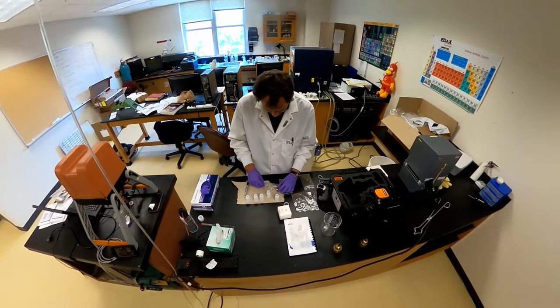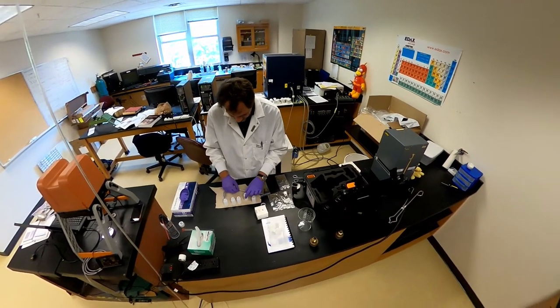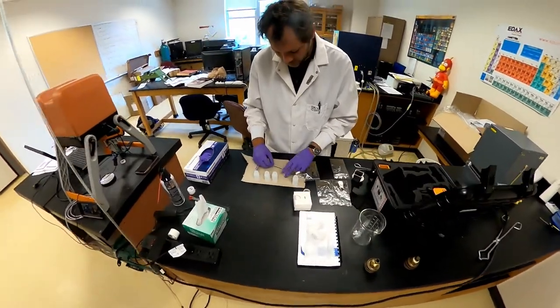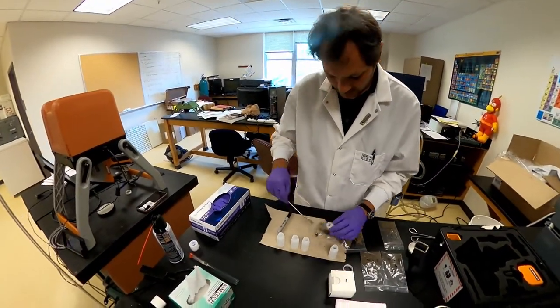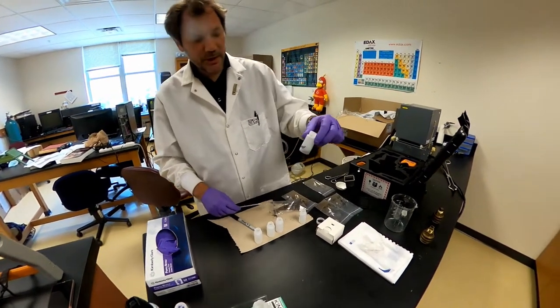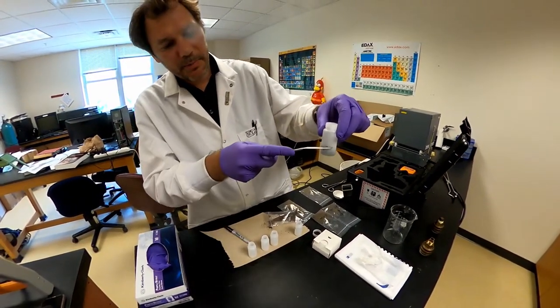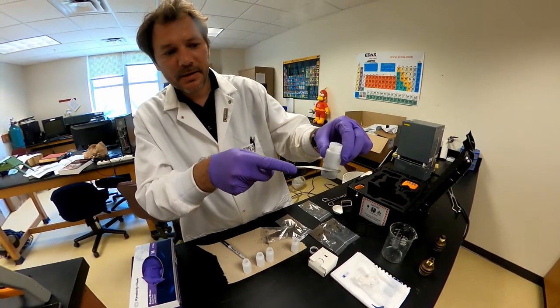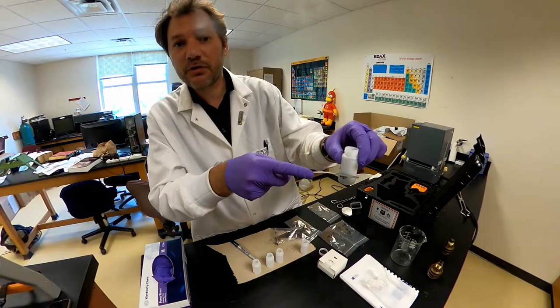Some of the key aspects when you transfer these samples is to make sure that you get all different grain size of the sample. All right, and I don't need to put more than that amount of sample. Well, basically, the sample is covering all the way to there. X-rays will penetrate the samples only a few millimeters.